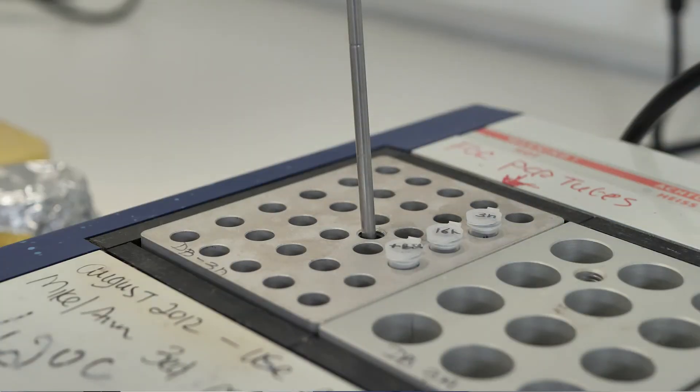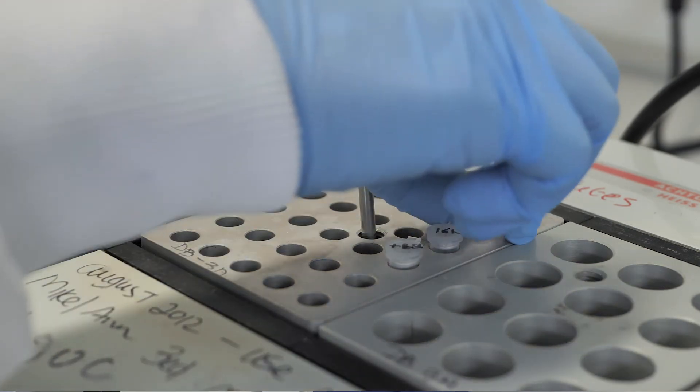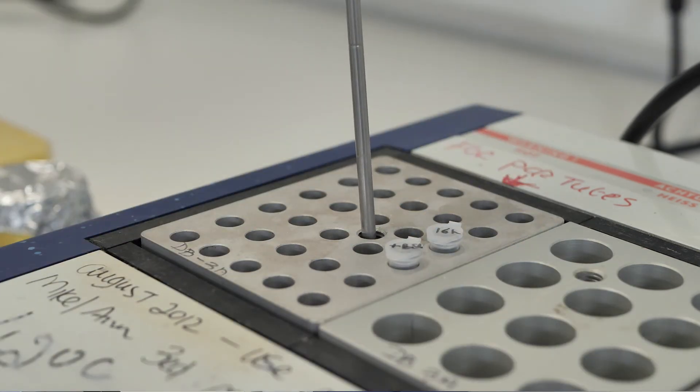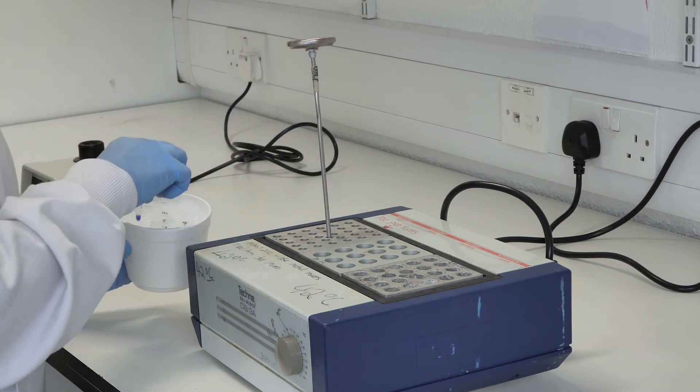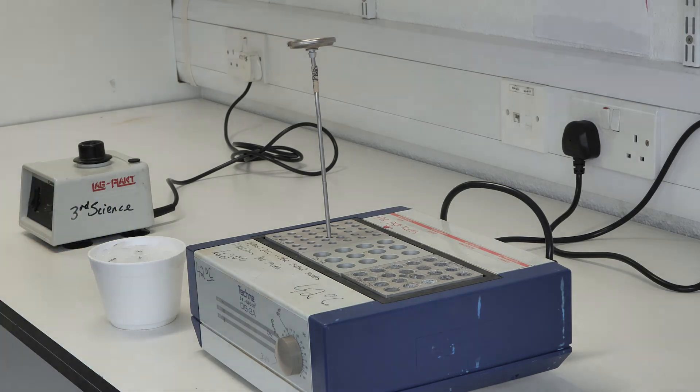Followed by 1 minute on ice. The samples are now ready for loading onto an SDS gel, but will be stored at minus 20 degrees for electrophoresis later.